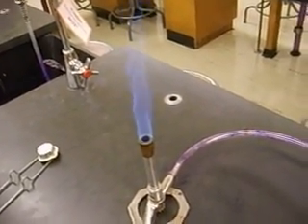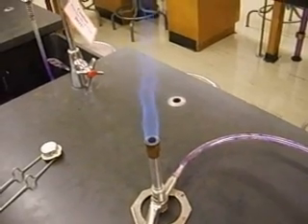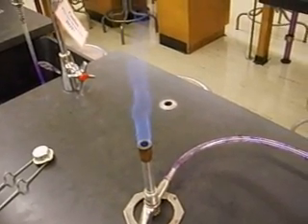All right, so that's the proper way to turn on the Bunsen burner without making a big huge flame that might end up burning you.